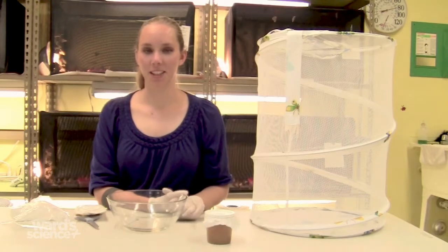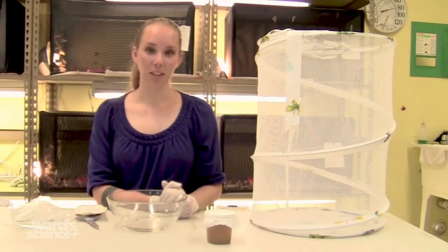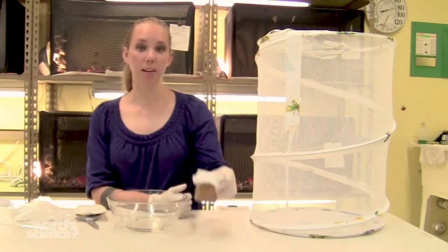Hi, I'm Elizabeth and I'm a lab technician in the Live Materials Lab. I'm going to talk to you today about your set of 30 Painted Lady Butterfly Larvae.